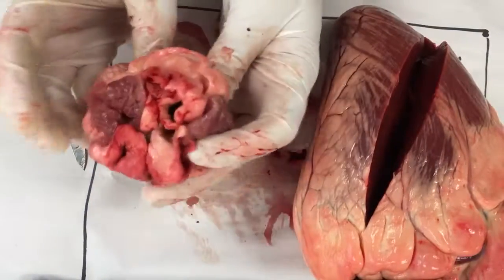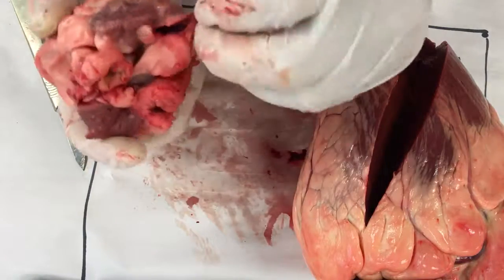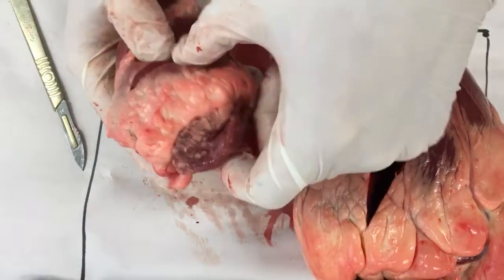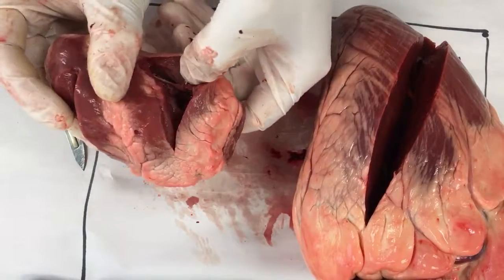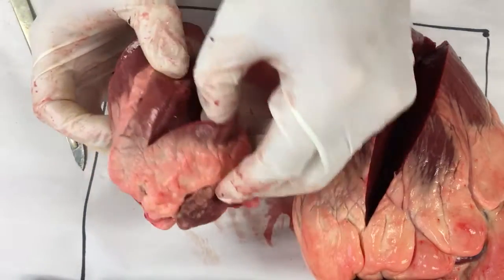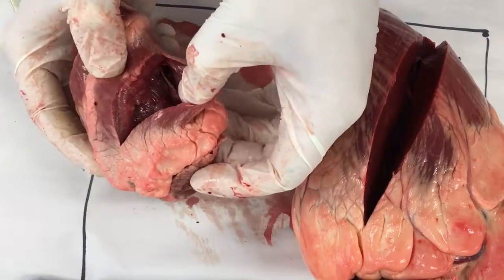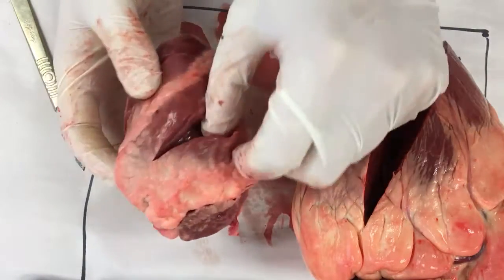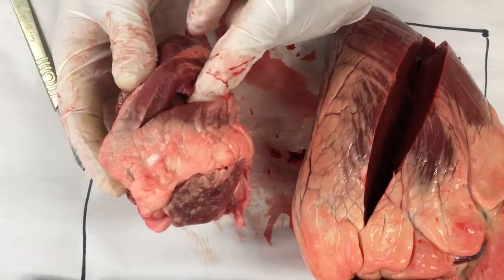On the lamb, blood is coming in through the top, in through here and filling up the right atrium — I forget it's on the wrong side of the body. The right atrium fills up to the top, and then it comes down with the valves up here opening and closing, down into the right ventricle.